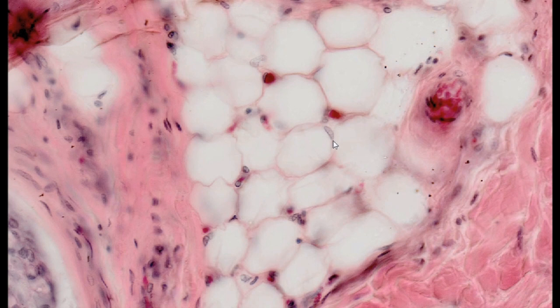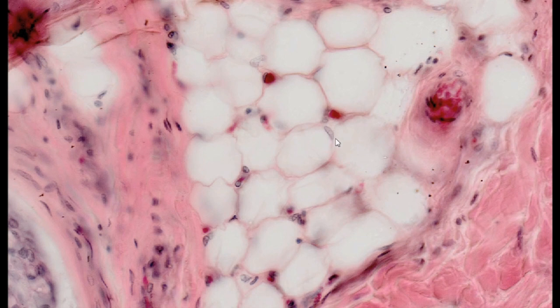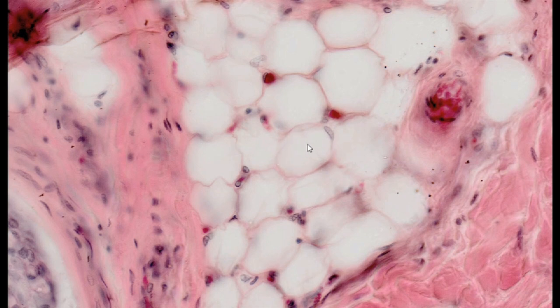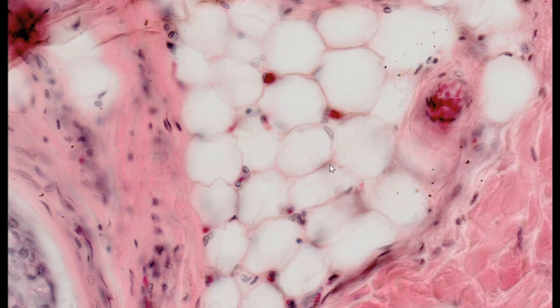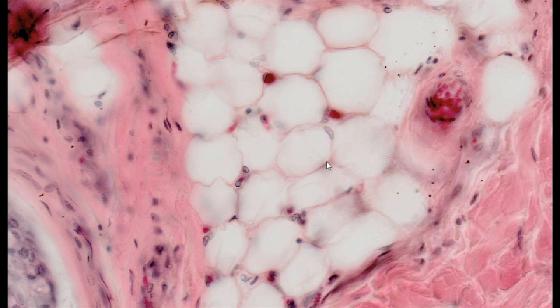Due to the peripheral location of the nucleus and the presence of a single lipid drop pushing the cytoplasm towards the periphery, the shape of a yellow fat cell is compared to a signet ring. This appearance is even more pronounced due to the empty area left by the fat drops that are dissolved out during the staining procedure.